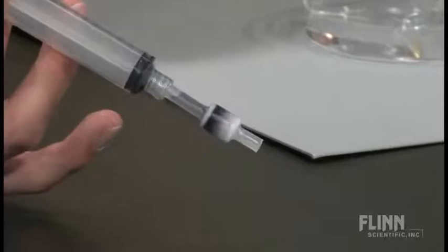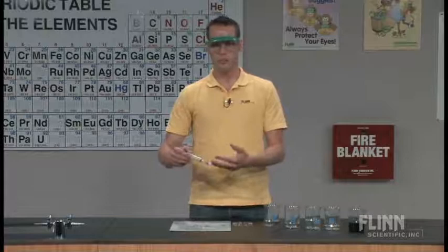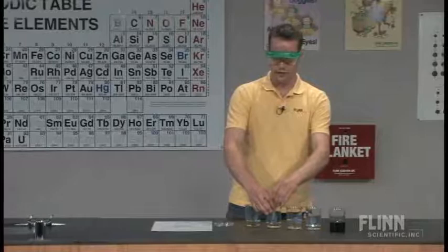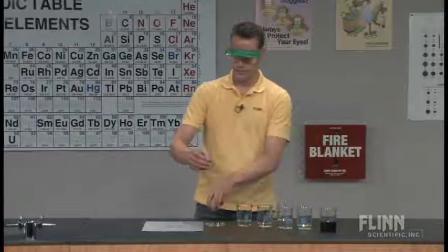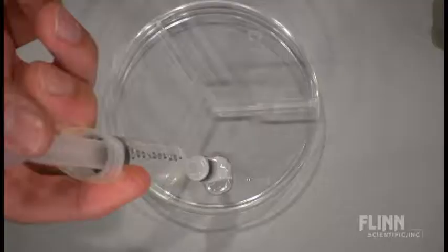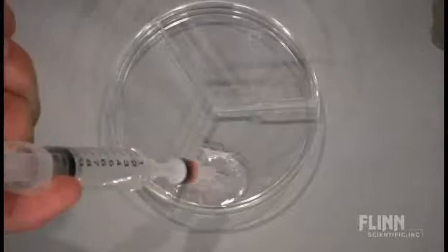So now we have this cartridge that we need to somehow separate. We have purple dye here. Well, purple dye isn't purple dye. It's a mixture of red and blue. So we have to somehow separate the red and blue dye from each other. If we use a different solvent, I've got 5% isopropyl alcohol here. If you pull up 10 milliliters of 5% isopropyl alcohol and start to push that through, you can start to see in the Sep-pack first that the red starts coming through, and then it will start dripping through and appearing in the dish.